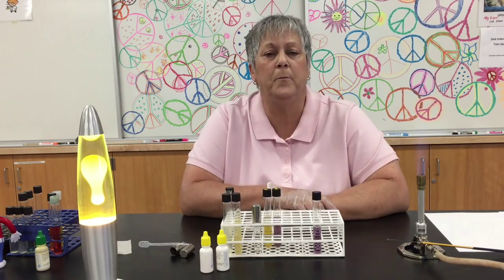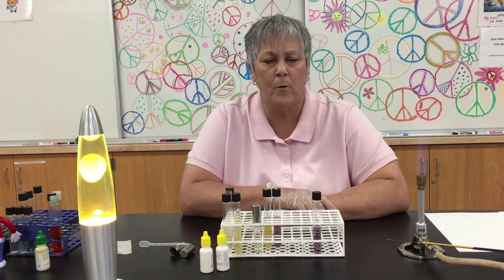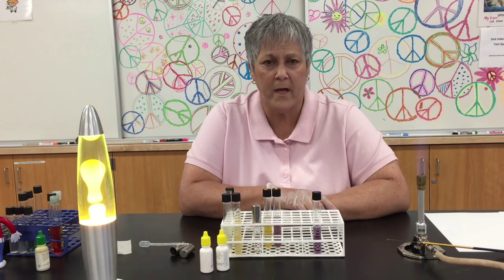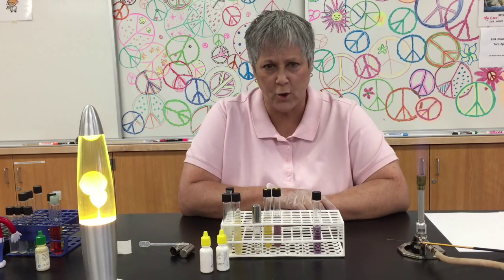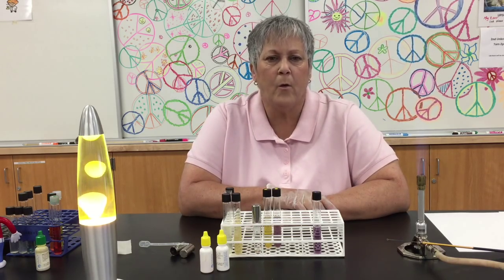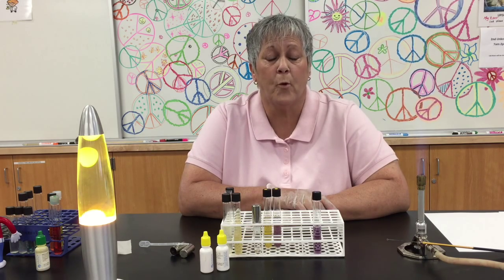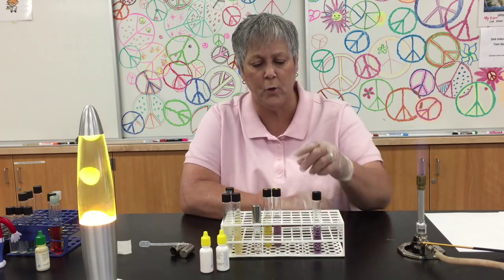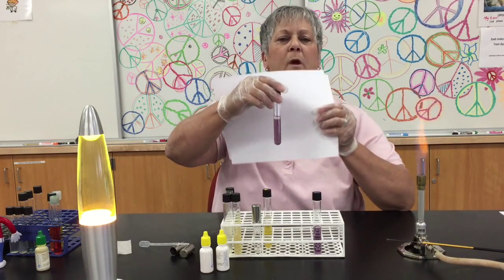These are going to incubate between 48 and 72 hours. You should check them at 48 hours — if you have a clear-cut positive or negative reaction at that time, go ahead and end the test. But sometimes the tubes will look a little wishy-washy. The only positive reaction that we're looking for would be that the broth remains purple but there's obvious turbidity, meaning evidence of growth in the tube. Here's a good positive reaction right here.